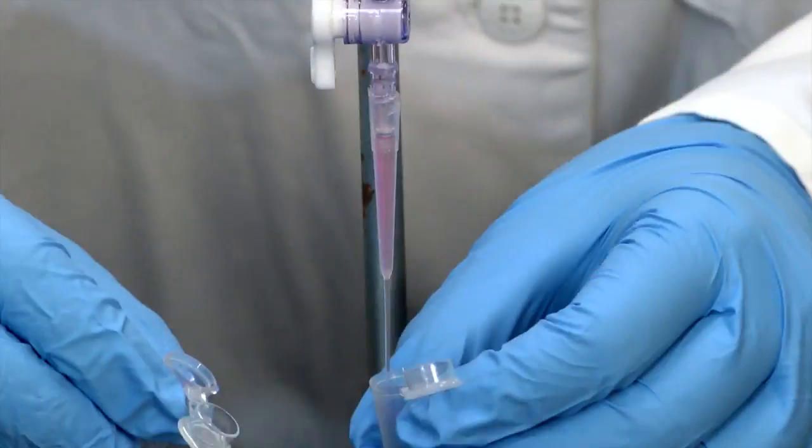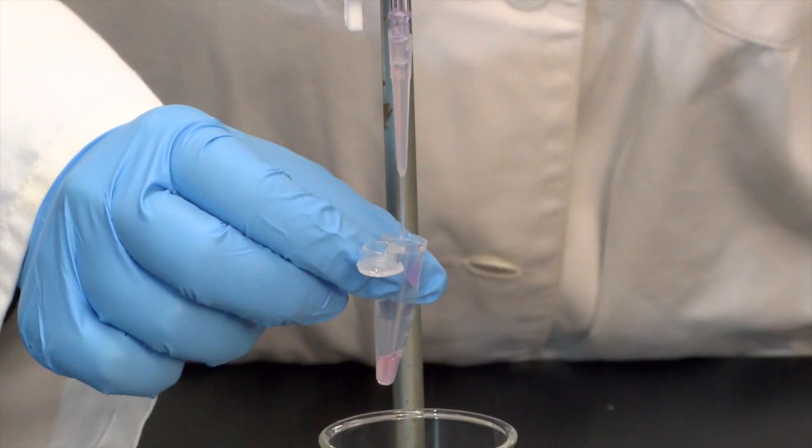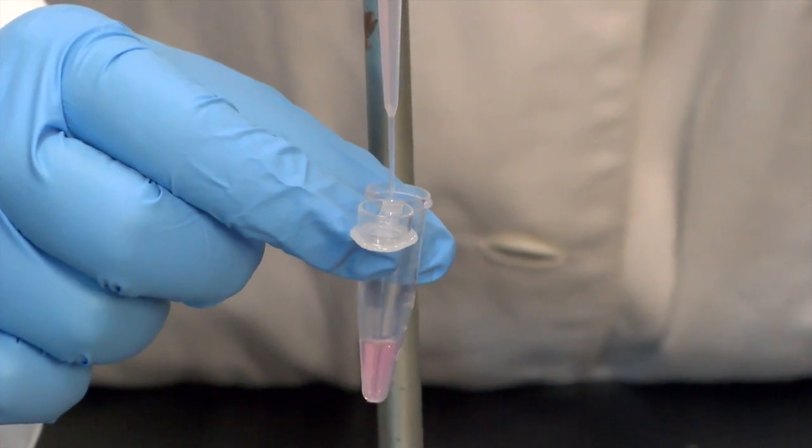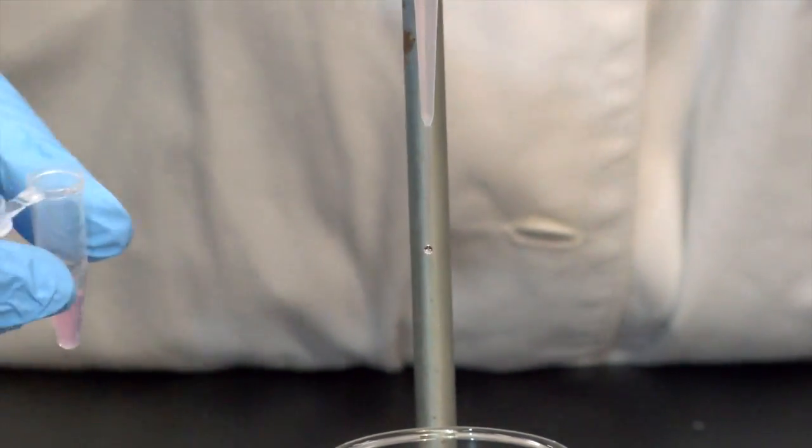If you are trying to get the most concentrated RFP, you may want to collect the initial and final pink drops in one tube and have a second tube to collect the darkest pink liquid.